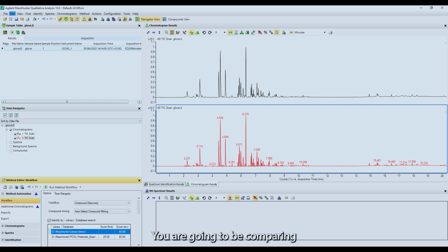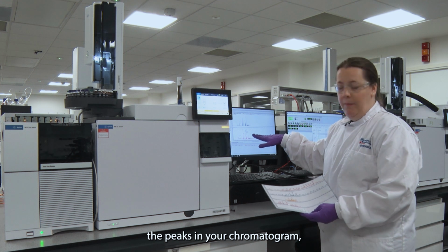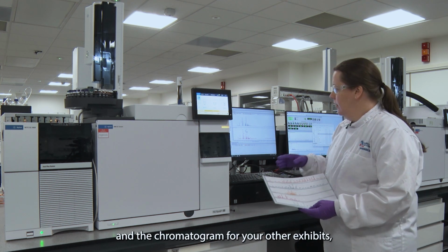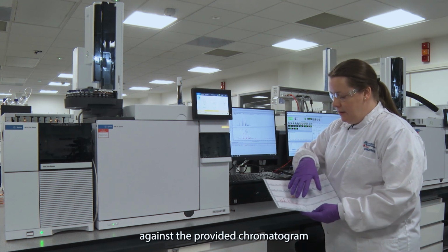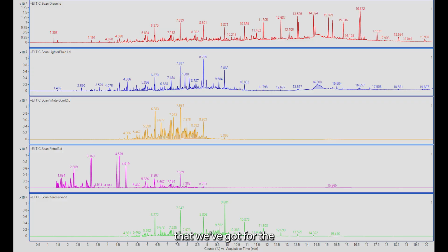You are going to be comparing the peaks in your chromatogram and the chromatograms for your other exhibits against the provided chromatograms that we've got for the possible accelerants that have been run.